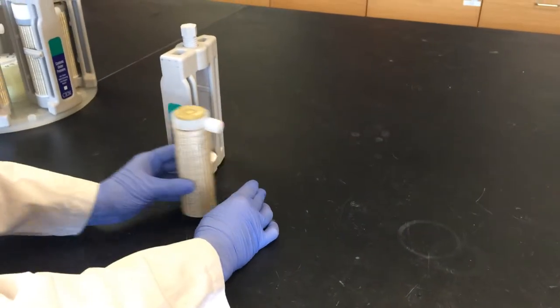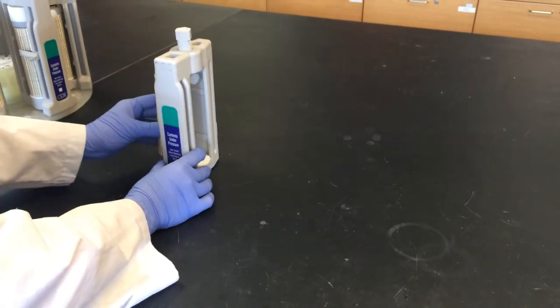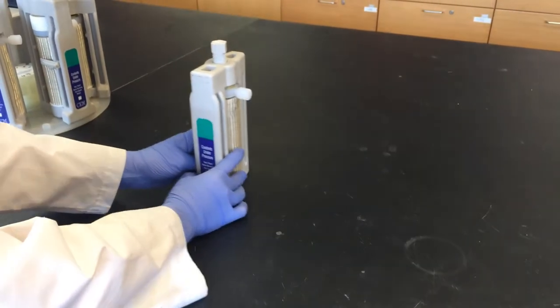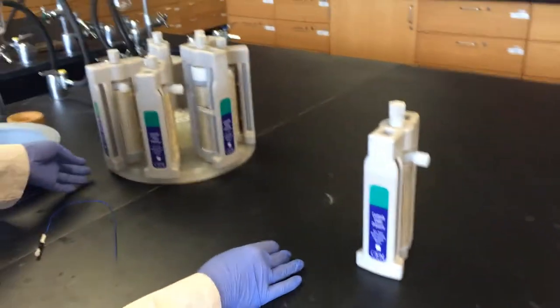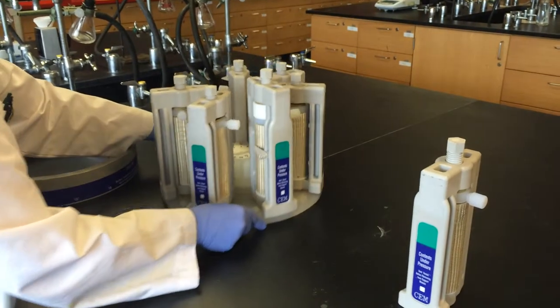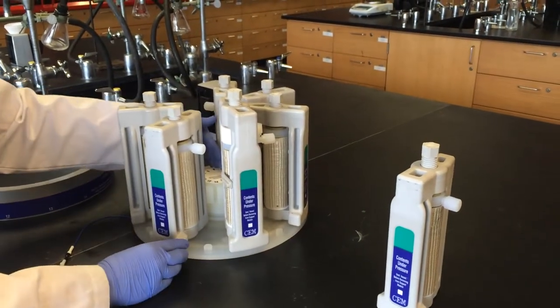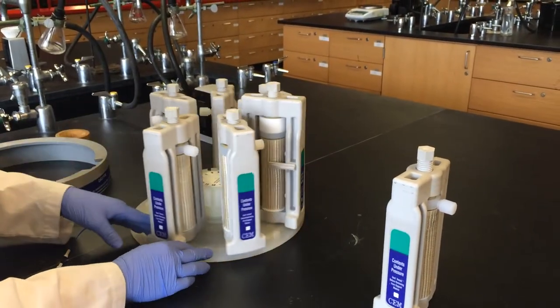This is a support module that the entire vessel is loaded into. Each of these support modules has a place on the carousel and the carousel spins in the microwave.